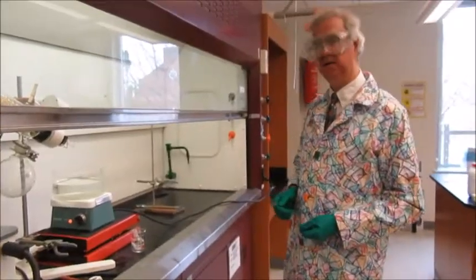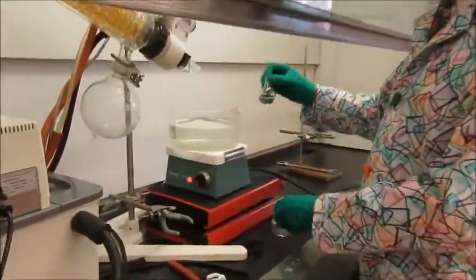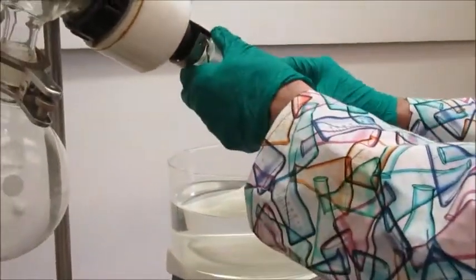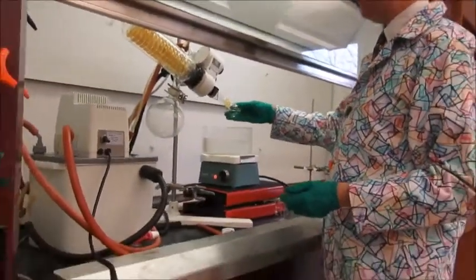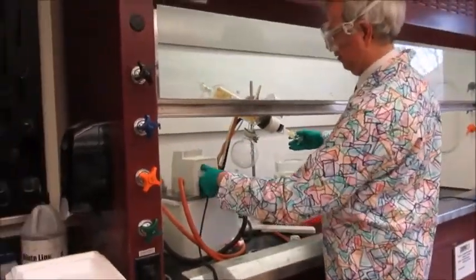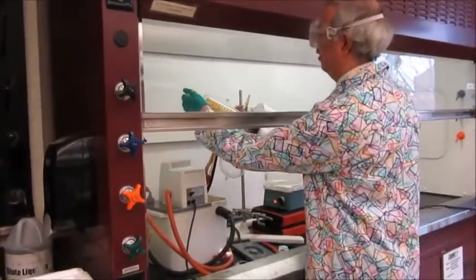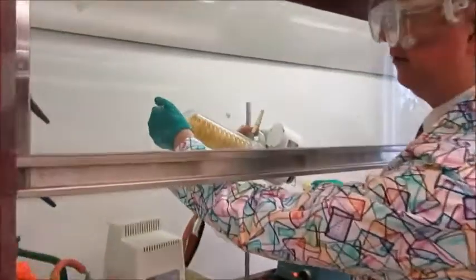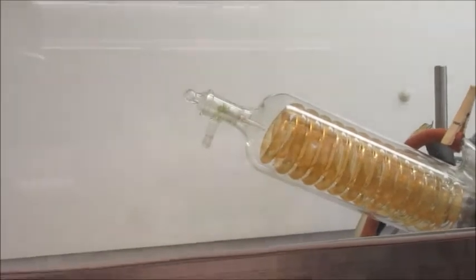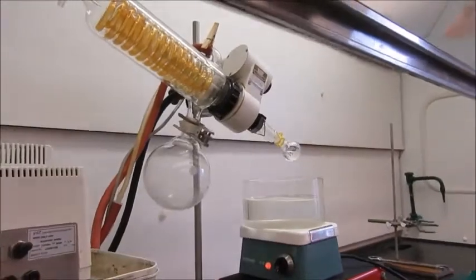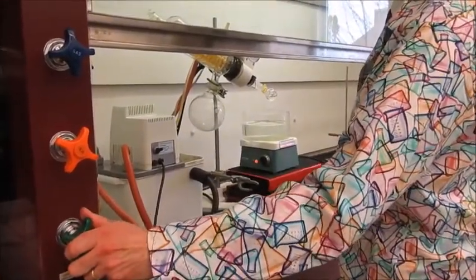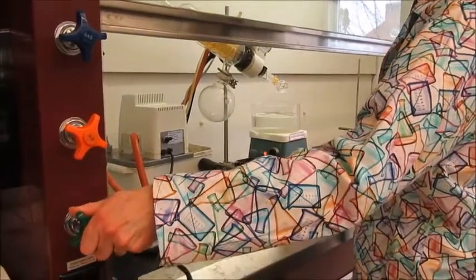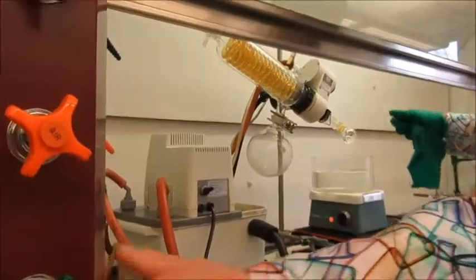Okay, so let's put this camphor on the rotary evaporator. Once this is evaporated down, it should give us our camphor. Before I start this going, I'm checking the vacuum on here - if I pull this, there's some resistance. I also need to start the water going. I'm going to take my glove off for that so I don't contaminate it. I'll start this turning now.